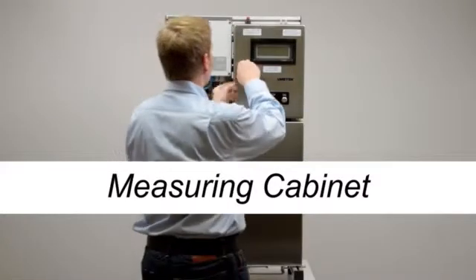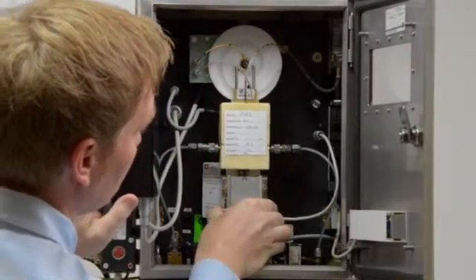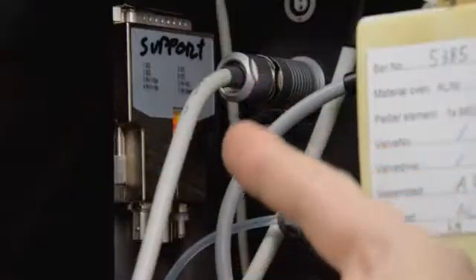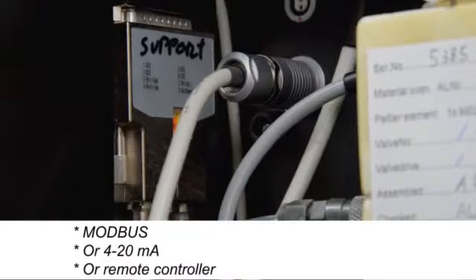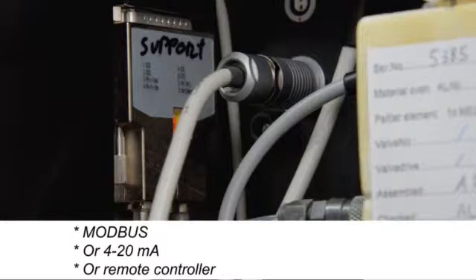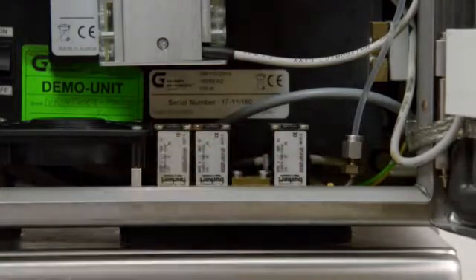The measuring cabinet contains the controller, the measuring cell with an integrated shaker, the automatic oiler, and the communication port with an RS-232 interface for Modbus data transfer. Other available communication options are a 4-20 mA converter for analog data transfer or the remote controller for monitoring the analyzer from a non-hazardous area. The measuring cabinet also contains two valves for different sample streams and one for the calibration fluid.